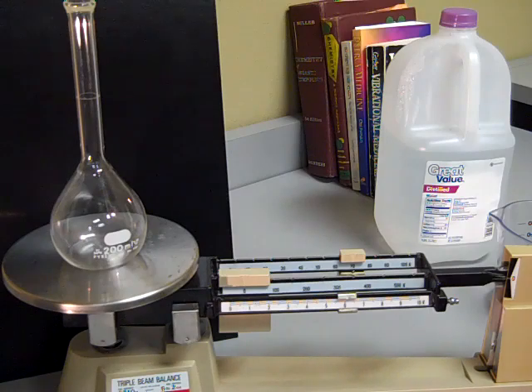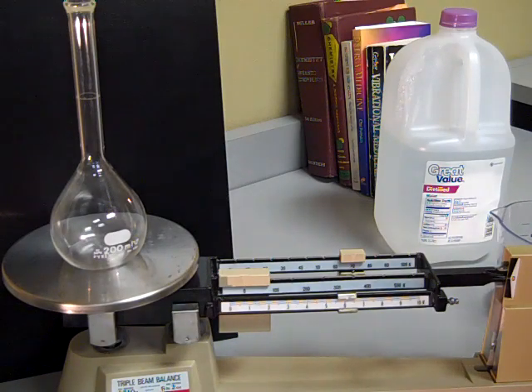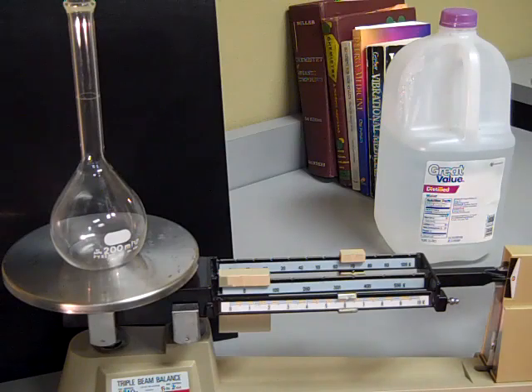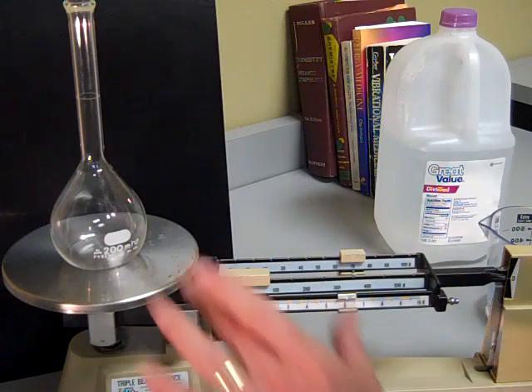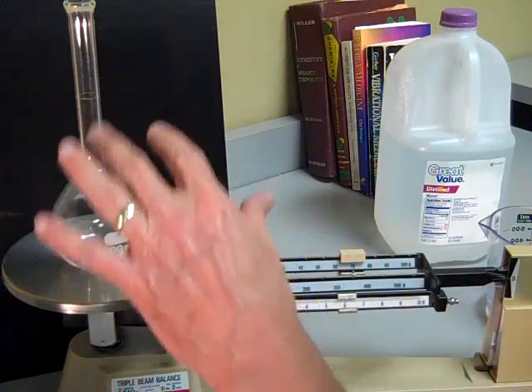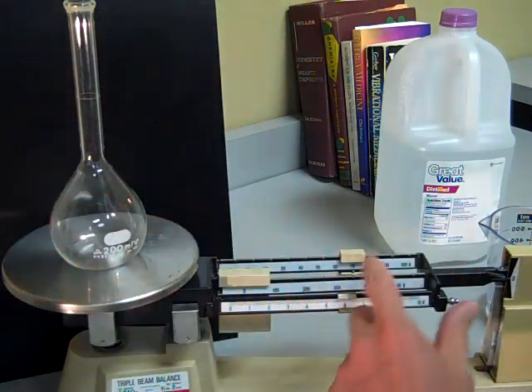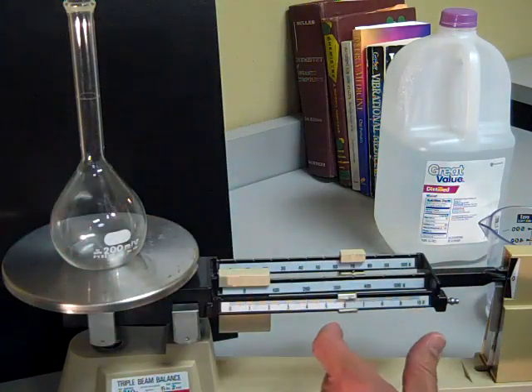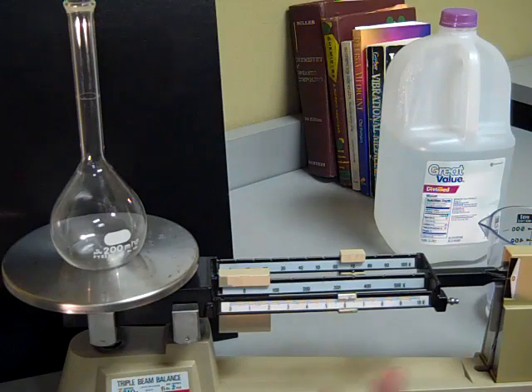This is a video to show the expansion of water at room temperature, something that's never been done before. We have a flask that is tared so that the weight of the flask is on the scale here at 76.1 grams.